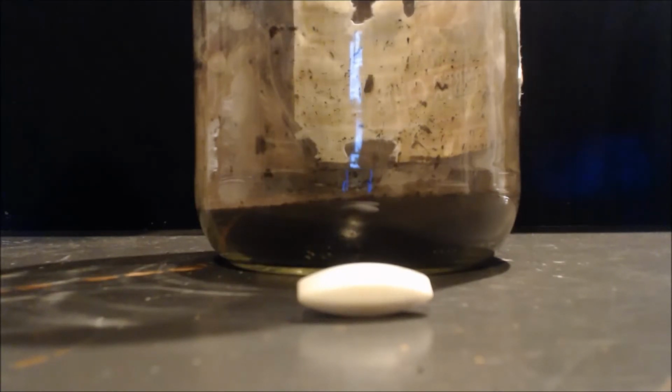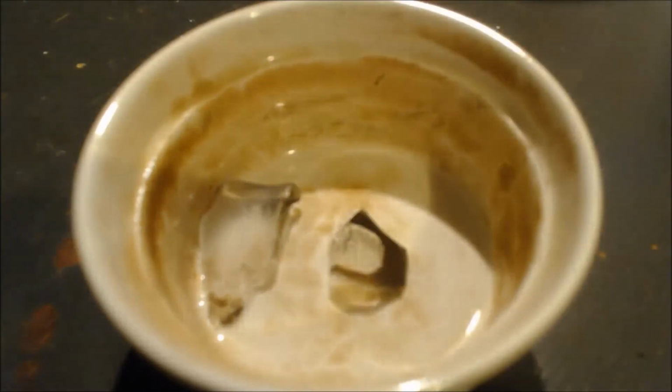But this next time, I'll decant it out, and then I will get the rest of this stuff out and put it in a vacuum filter, a frit filter, and put a vacuum on it, get it nice and dry, and then I'll put some more distilled water on it and suck it through again, get it nice and dry, and then I'll throw it on a plate to dry it, and I'll have nice pure MnO2.